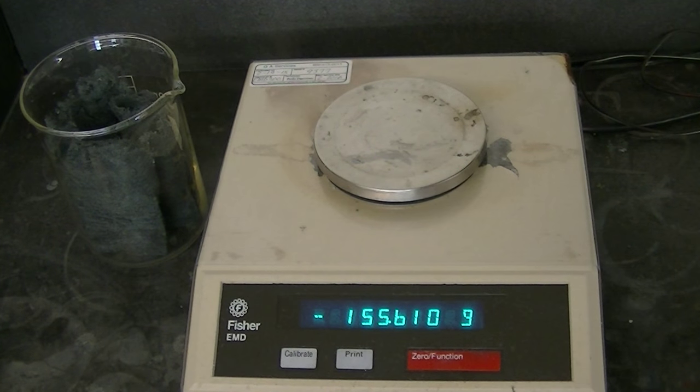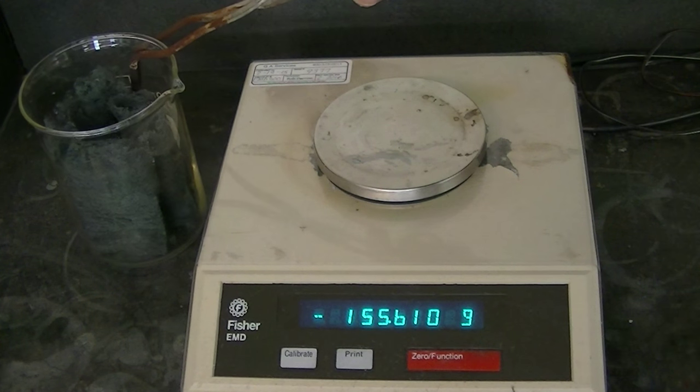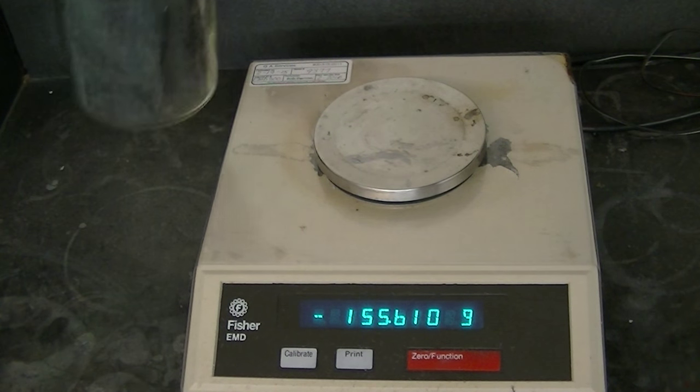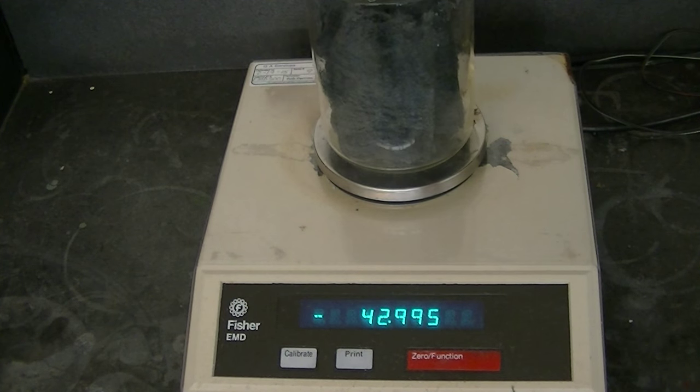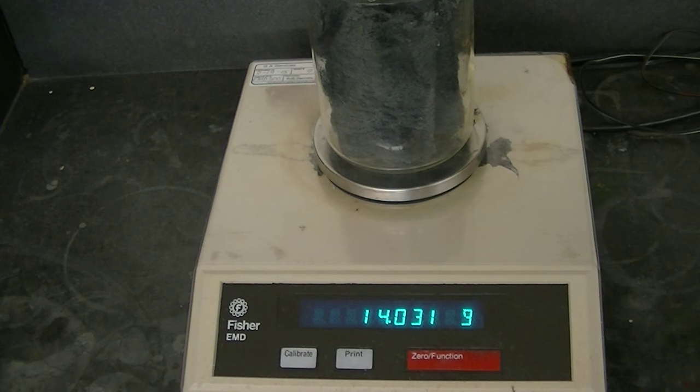Okay. We're now going to find out if our steel wool has changed in mass. I'm going to handle this with tongs because it's still hot from the reaction. And you'll notice that the mass has gone up. This is a surprising result for a lot of people.